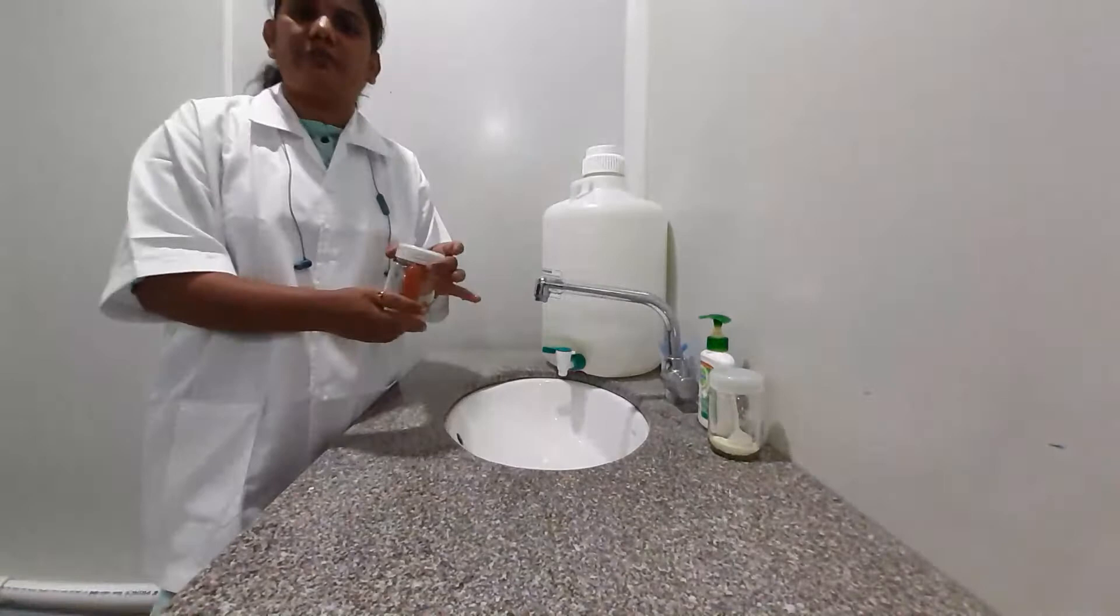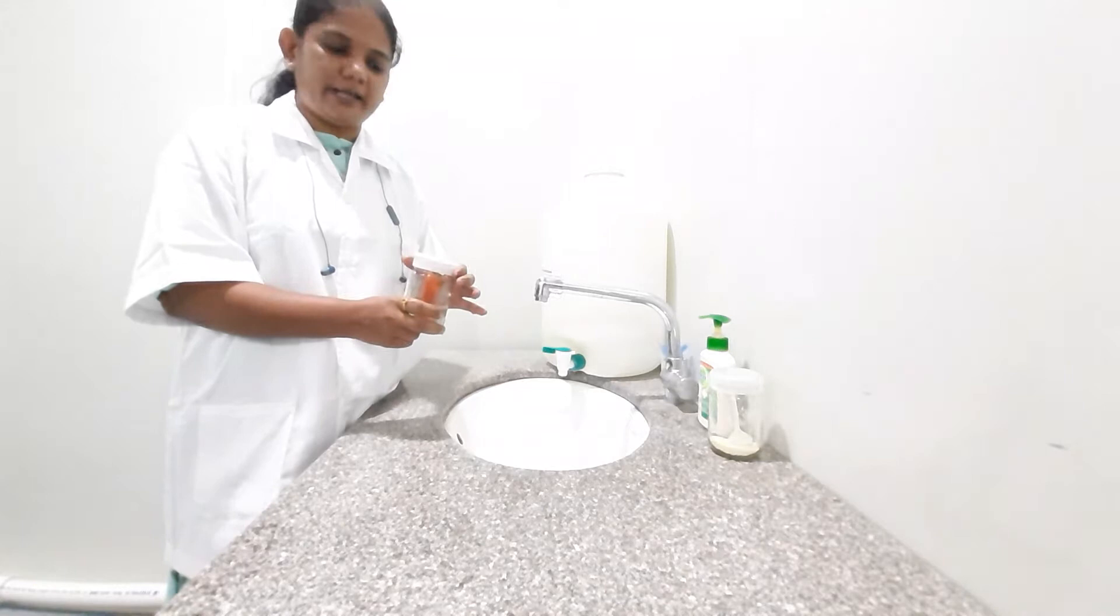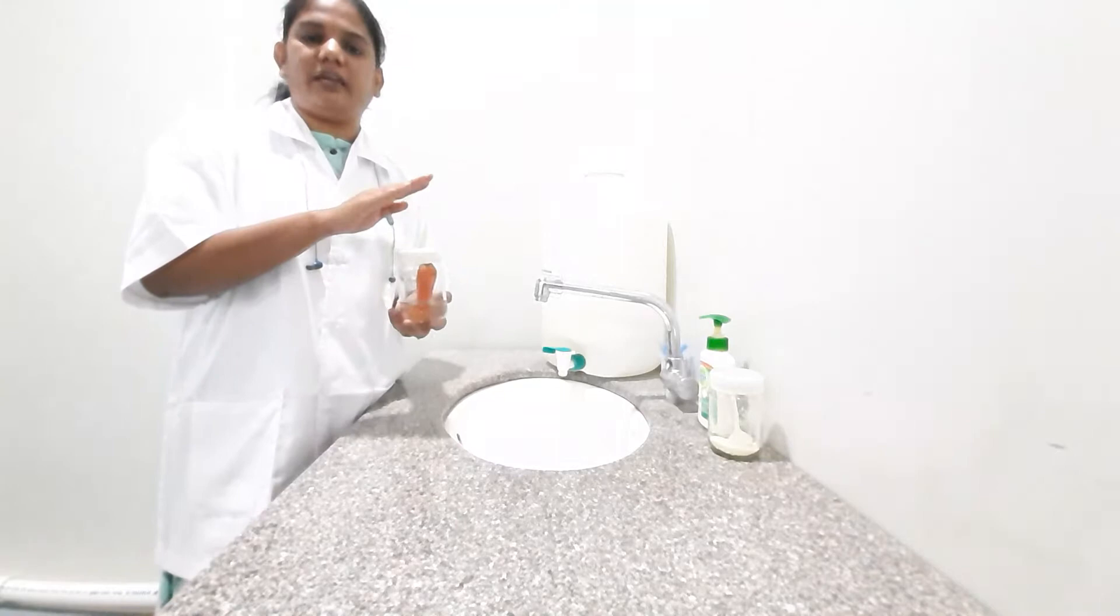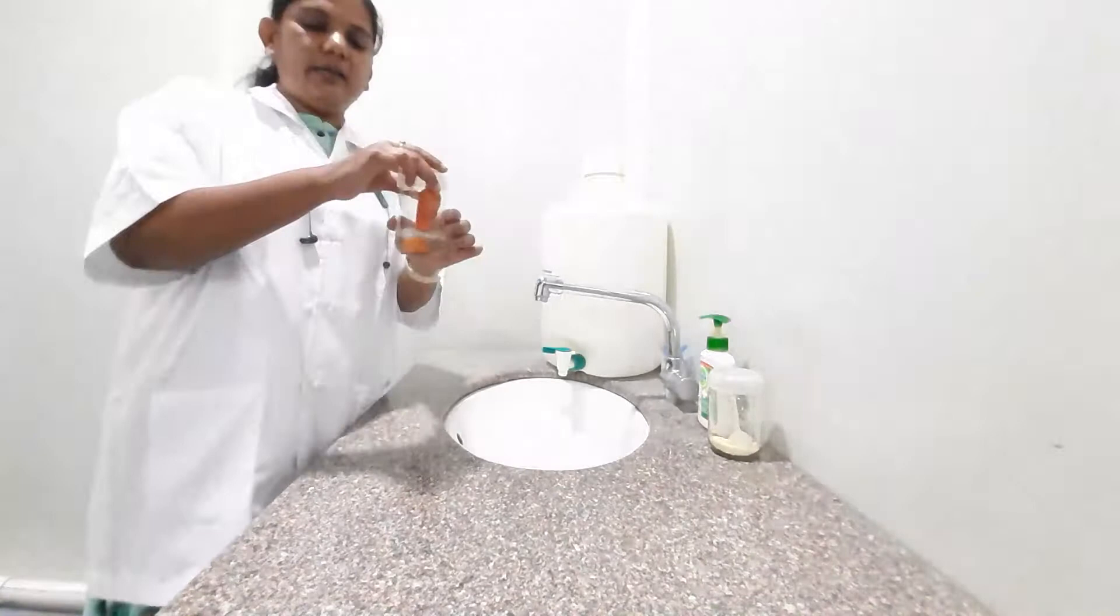Hello students, today we are going to perform practical number 7 from your course SC214, Applications of Biotechnology. In this practical, we are going to conduct the initiation of callus culture from carrot. For that, we will be requiring a carrot.